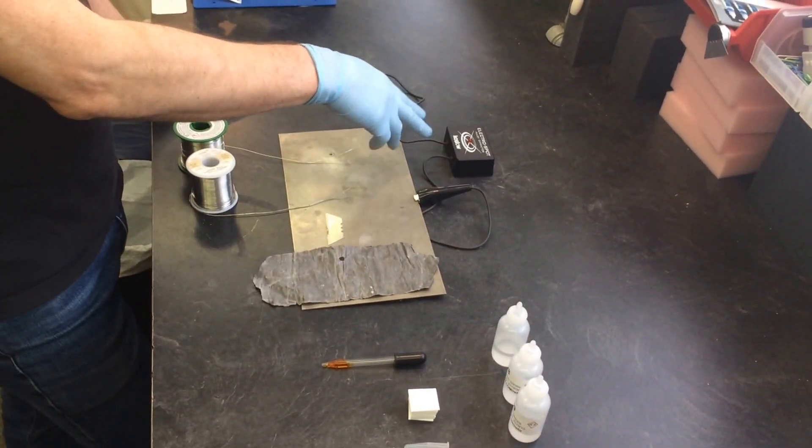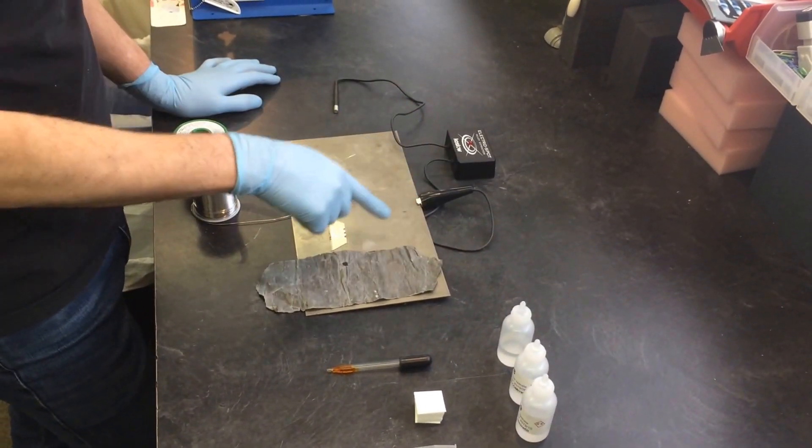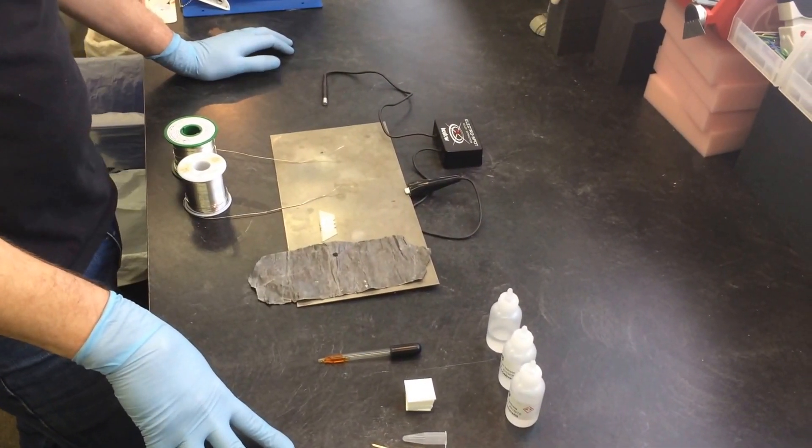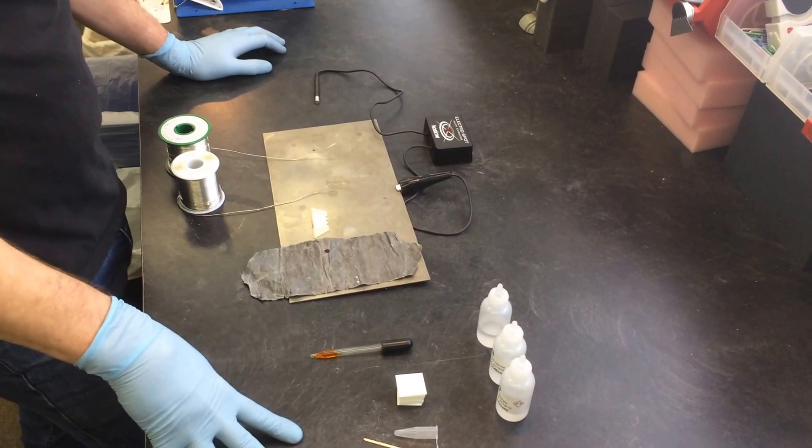And this is, of course, the electro spot process. I clipped onto just an ordinary sheet of metal. You could use a piece of aluminum foil. It's easier if you're performing multiple tests at the same time.